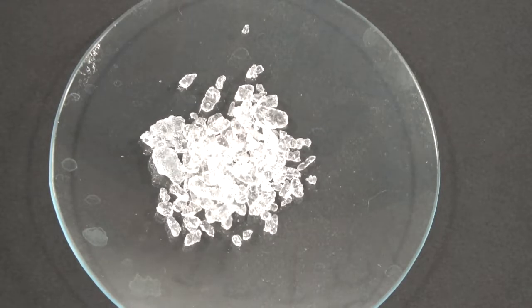Here's a watch glass with a few grams that I'm going to leave out in the open air for a few days and see what happens. In the meantime, let's talk about what dibasic means.